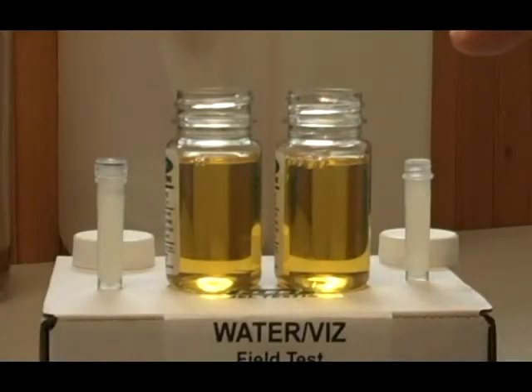What we're going to do is a side-by-side comparison. These are the same fuel we've added to two different tests. We're going to add one drop of water to the test on the right so we can see the difference between a pass and a fail. That's a single drop of water, about 30 microliters. I'm just going to shake that water up just a little bit.